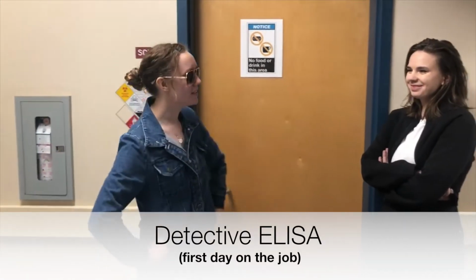I responded to a call at UBCO about a murder or a dead body or something. Whoever did it left a bunch of physical evidence. They weren't a very good murderer. We found a bloody Erlenmeyer flask. Anyway, we need to find out if this blood belongs to Dr. Plunkett or the murderer. Luckily, the forensic techniques for determining the source of the blood weren't too difficult.